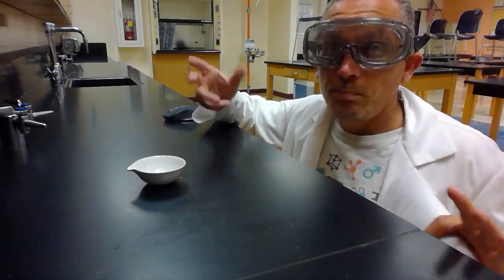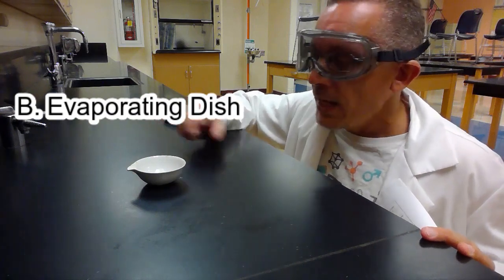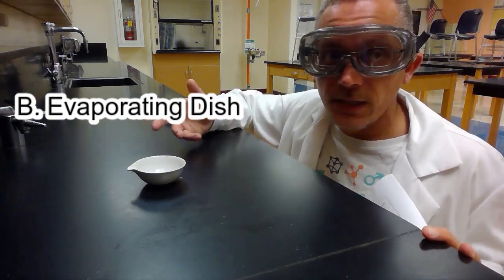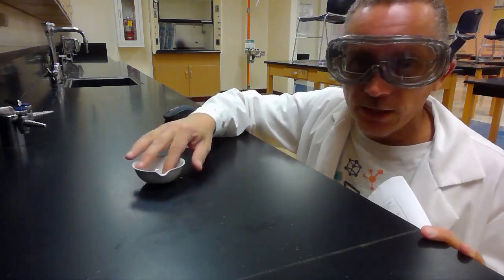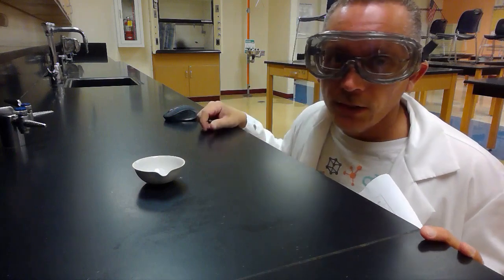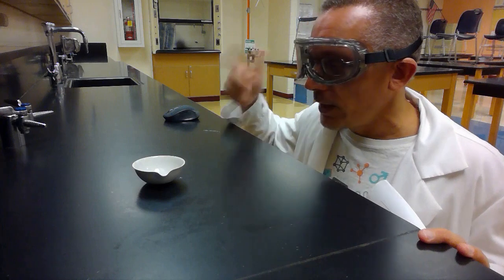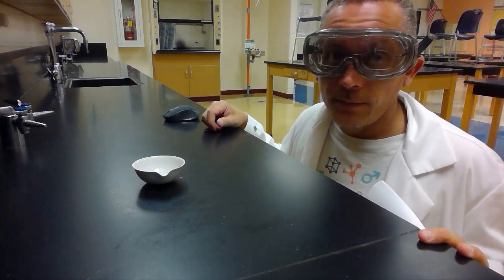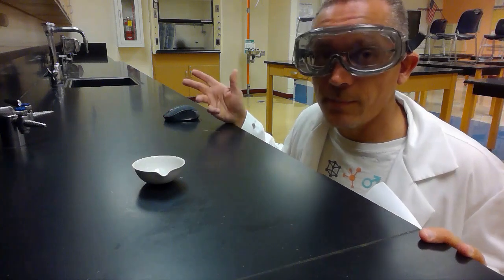Here you can see Picture B. Picture B, this is what's called an evaporating dish, right? An evaporating dish, if I have something that I want to evaporate away, I can put it in the evaporating dish and let it sit there for a while and evaporate. Fun story, don't try to heat these, they will crack and fall apart, right? So that is Picture B, the evaporating dish, and it's used to allow something to evaporate.